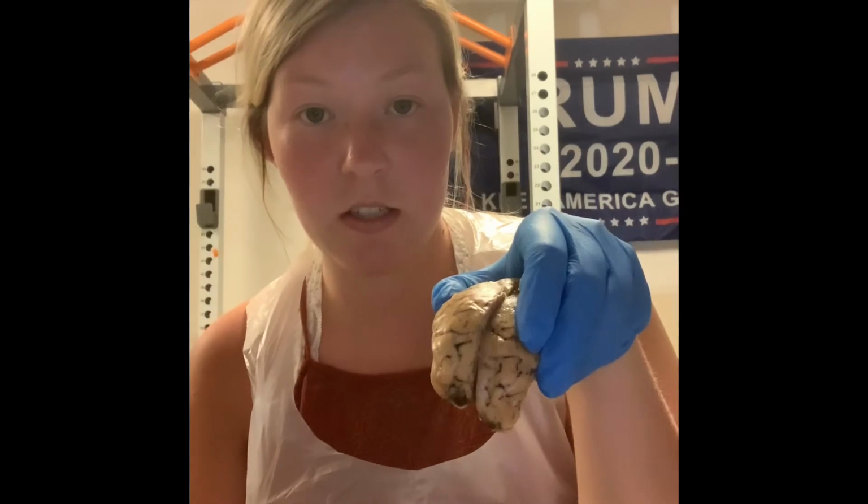So next we have our corpus callosum, and we can find that right here in this region. The job of the corpus callosum is just to relay the information between the two hemispheres of the brain. Next, we have our thalamus, and it is right here. And its job is to relay sensory information, control alertness, sleep, and consciousness. And so that's our thalamus, right?